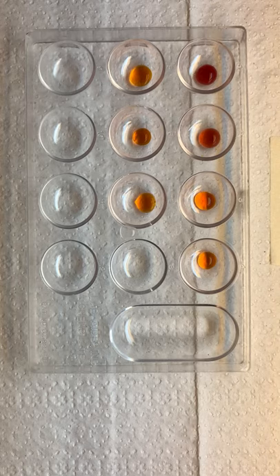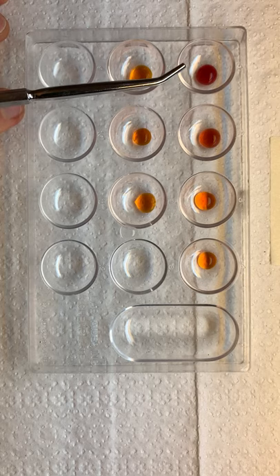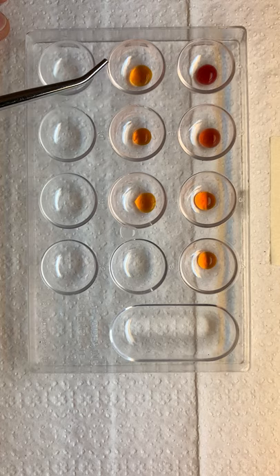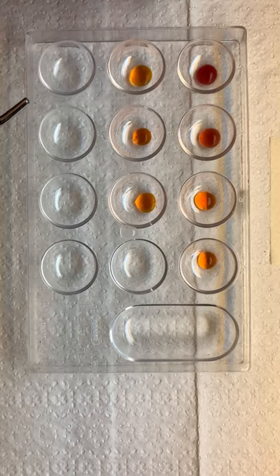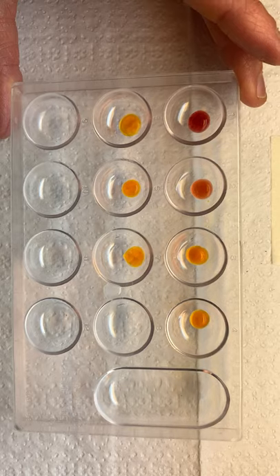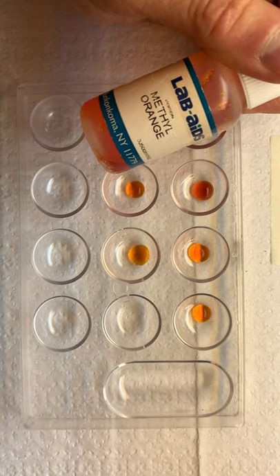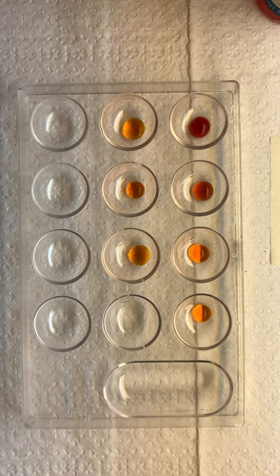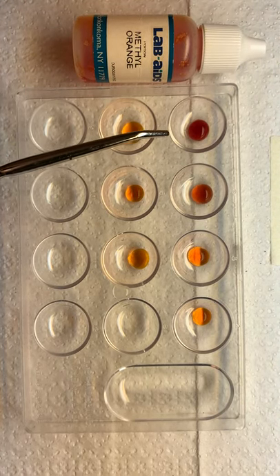So you can see based on this experiment where we've added methyl orange to pH one, three, five, seven, nine, eleven, and thirteen — where did we get a color change? Remember that methyl orange is orange, so where it's not orange in this tray is where there was a color change and where methyl orange reacted to the pH that was introduced. So where did it react?